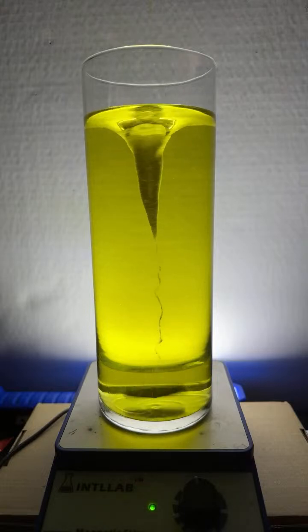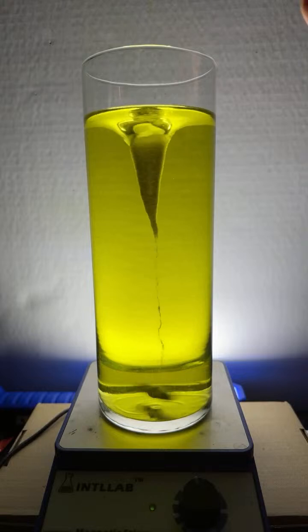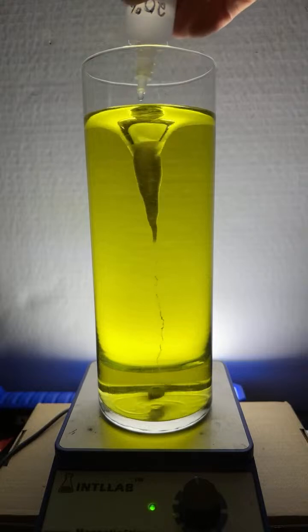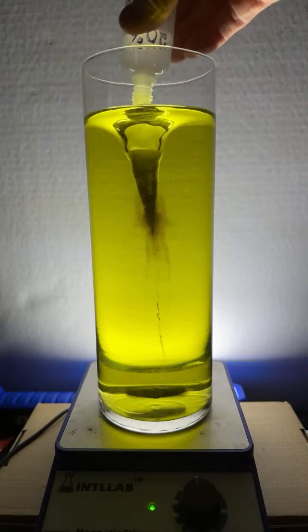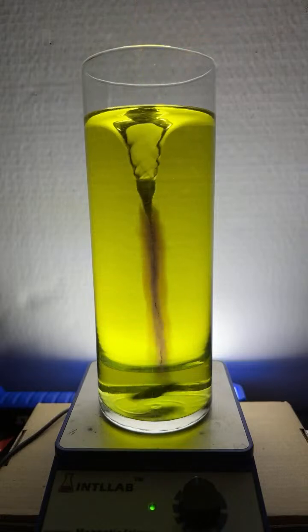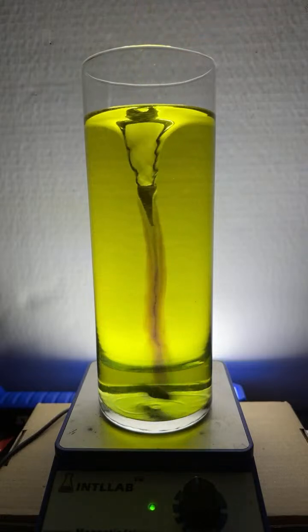And that'll be easy to see. It reacts with it, and it actually makes something that dissolves into the water. So you can watch what happens to those bubbles when I add the sodium hydroxide. Look at that. Look at your funnel. See how your funnel is losing the bubbles?